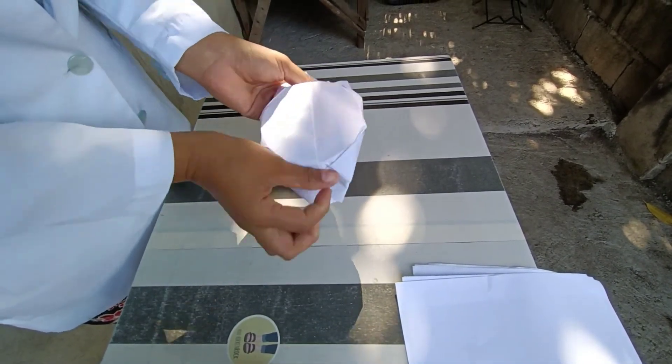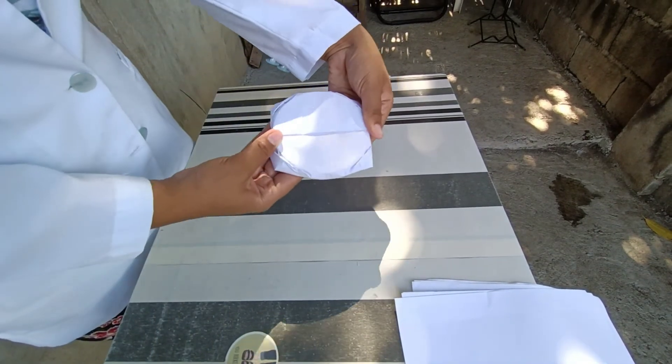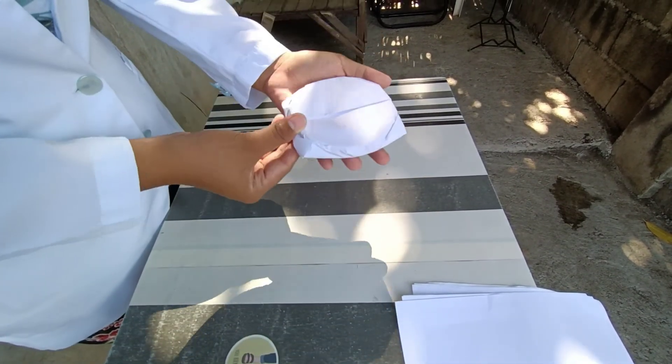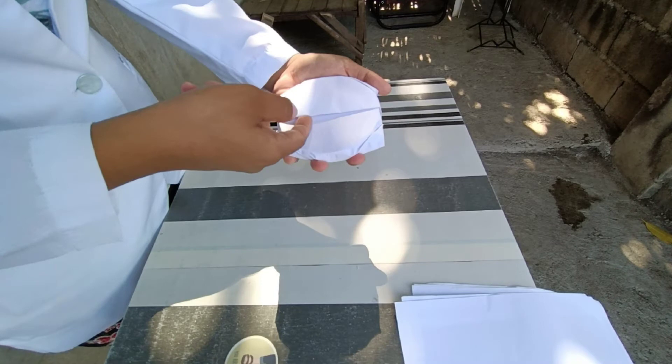Then lastly, fold to the opposite side downward. The purpose of the fold is that moisture cannot enter the petri dish because it is sealed.